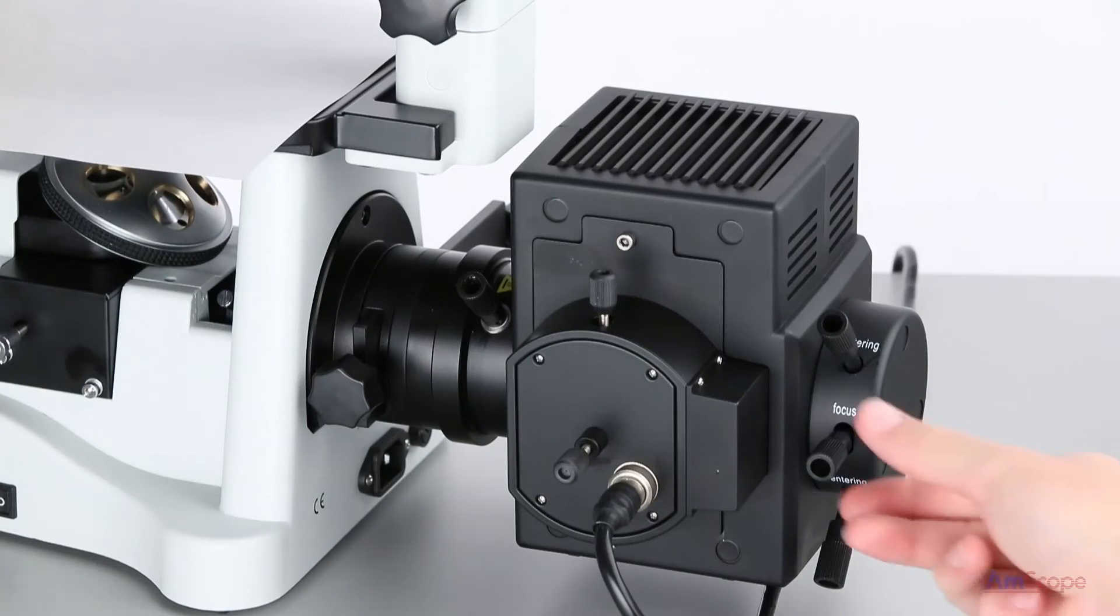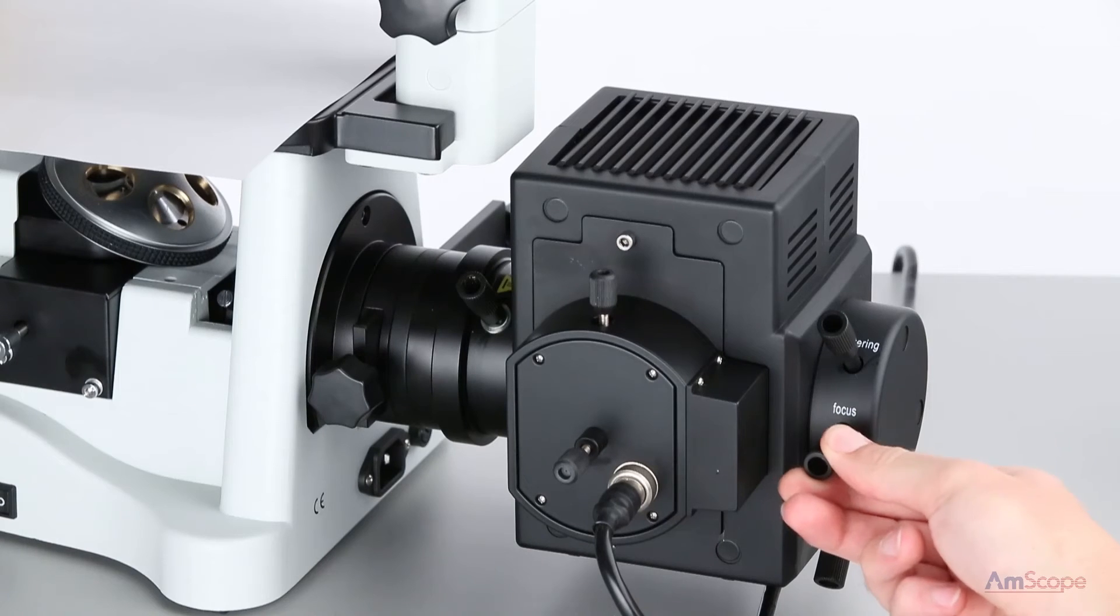You should see two distinct light projections. If the reflected light is out of focus, use the rear focus knob to put it into focus.